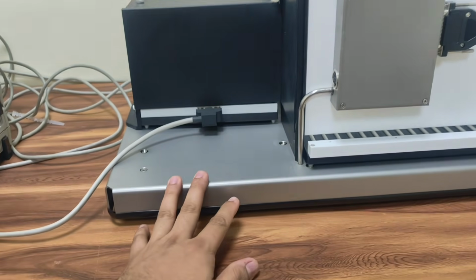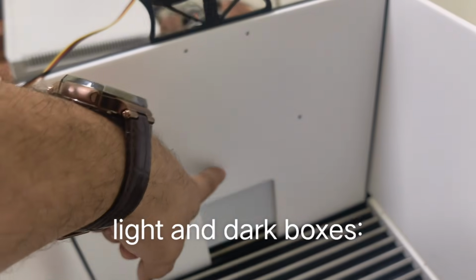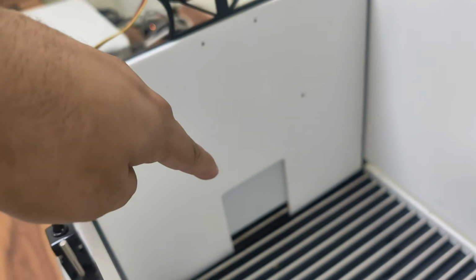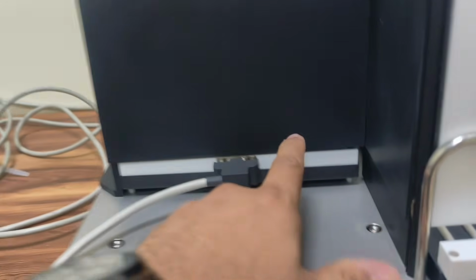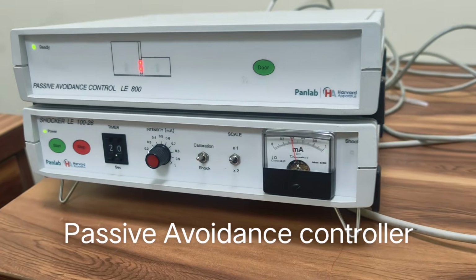This is called a load cell. This is the light environment, this is the dark environment, this is the guillotine gate. This is automatically operated via the software. We can manually open it, or we can set an algorithm to open and close according to the stimulus. Now this is the electrical grid which is present inside. This is the weight grid. This is the passive avoidance controller. This is the shocker along with the potentiometer.